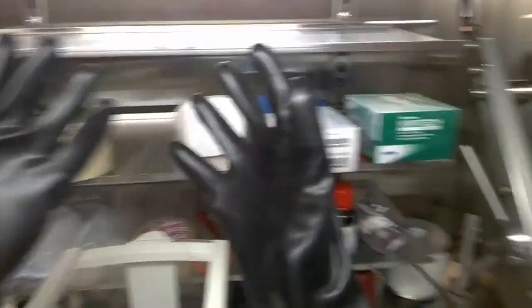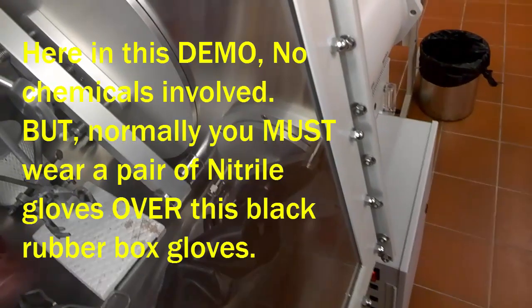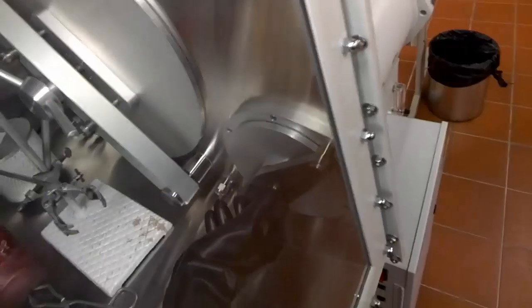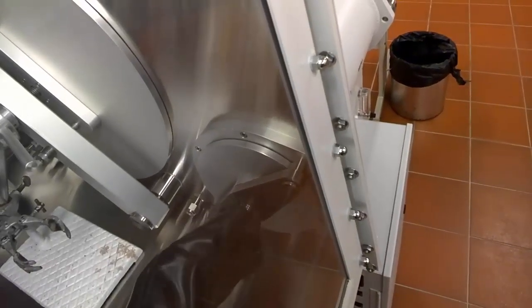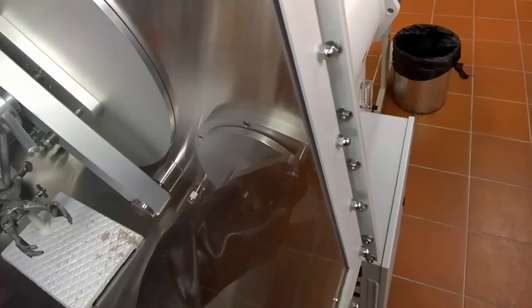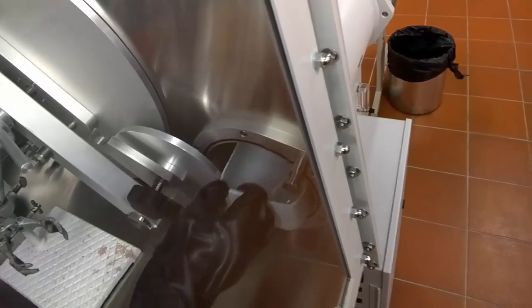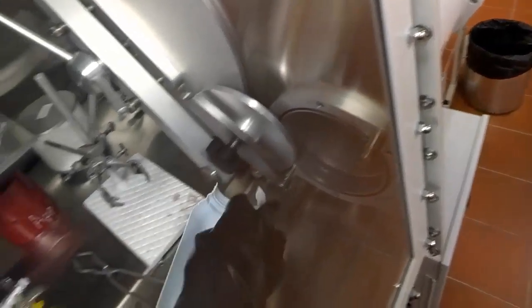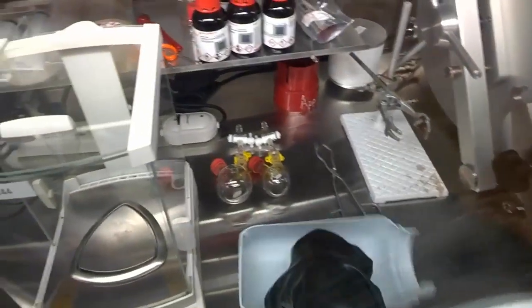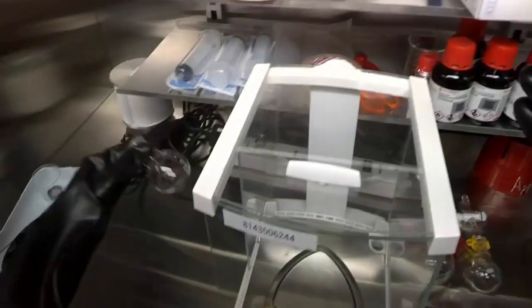And next. This is where the chamber is. And we got our substance. In this demonstration, because I'm not going to show you how to add chemicals, it is not dirty, I'm just going to show you how to open the door and close the door. I did not put on any gloves. But in the future, if you need to transfer any chemicals or add chemicals and weigh them, you have to wear another pair of gloves inside the glove box. So rotate the screw counterclockwise. Loosen it. And then open the door. Be gentle. And take out whatever you need to. Be very careful. You see that's the reason why I told you to put it all the way in. So in this case we have a round bottom flask. Right. Yeah. And so now everything is inside the glove box.